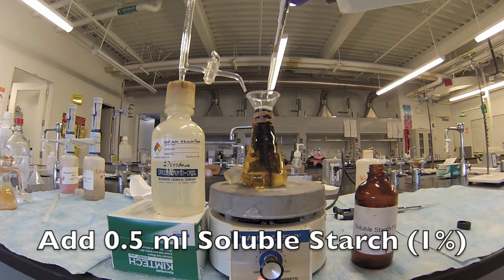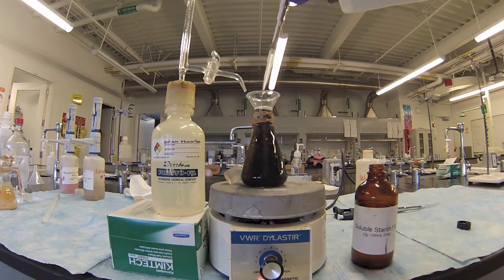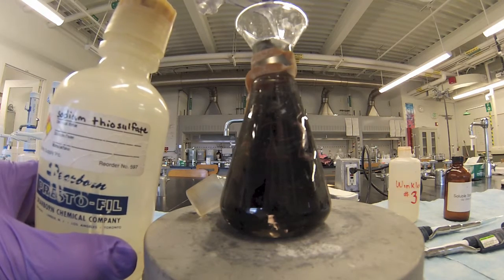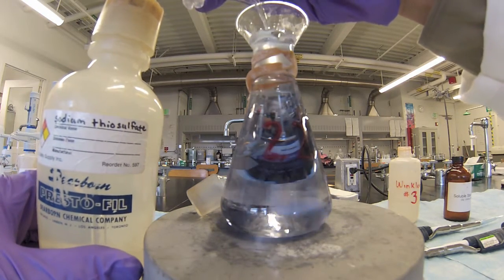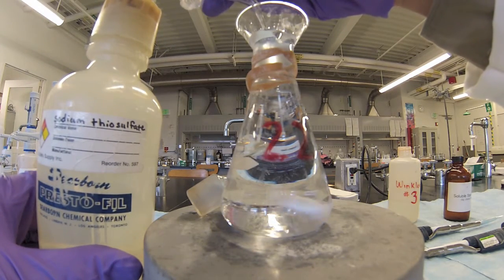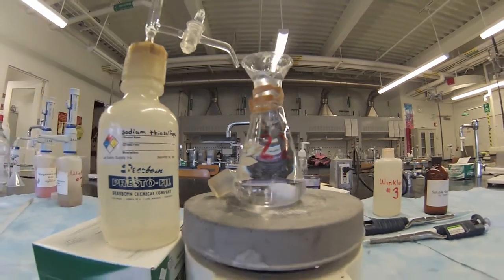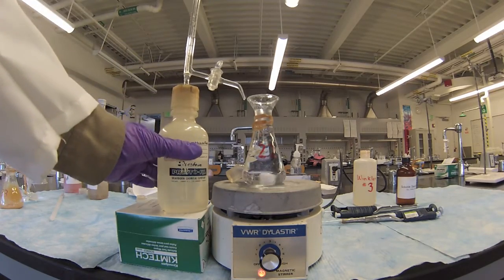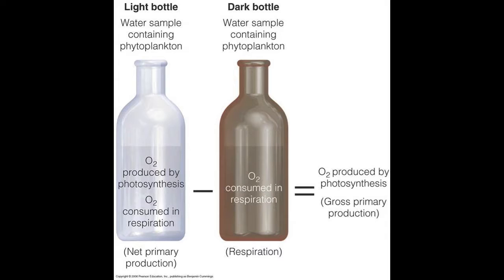Add half a milliliter of starch to change the sample to a dark blue. This will allow the endpoint of titration to be seen more easily. Continue to carefully titrate until the sample goes clear. When the sample is completely clear, we have reached the endpoint of our chemical reaction. Record the volume of sodium thiosulfate used on your data sheet. With the volume of titrant and the volume of the sample known, the dissolved oxygen concentration of the sample can be found.